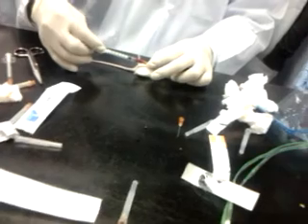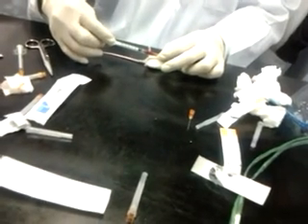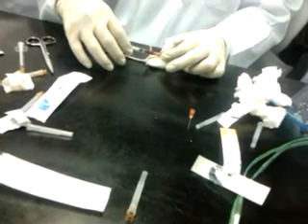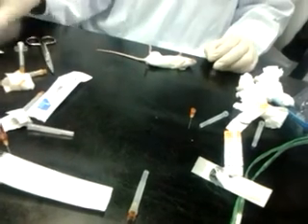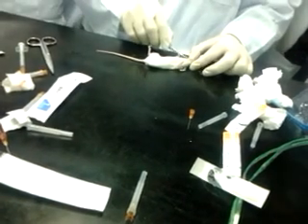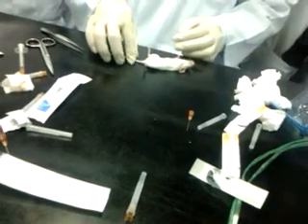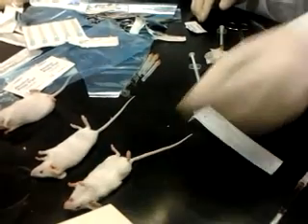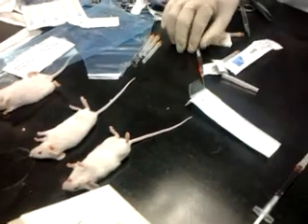Stop. Okay. Then we stop the plunger and pull out the needle. So 0.3. Okay. You can see whether they recover. Okay. You should be alive. You shouldn't die. We don't want you to die. We want you to be alive. We take cardiac puncture so that you get 0.3 ml. This blood is sterile blood. It can recover. It can be normal until you want to bleed the next day.